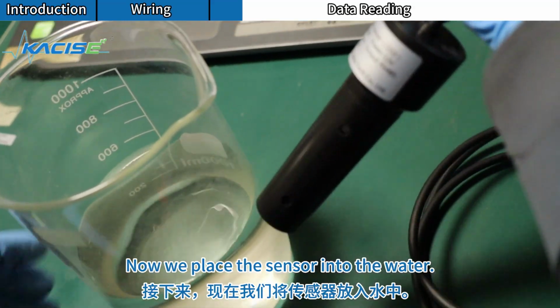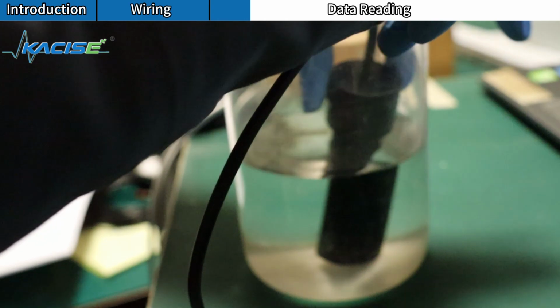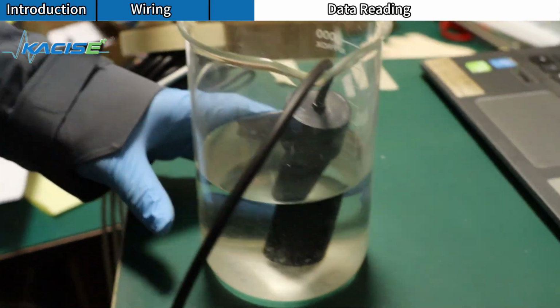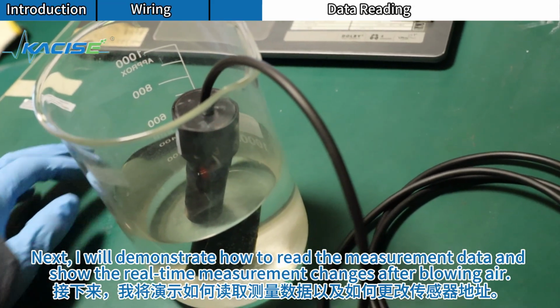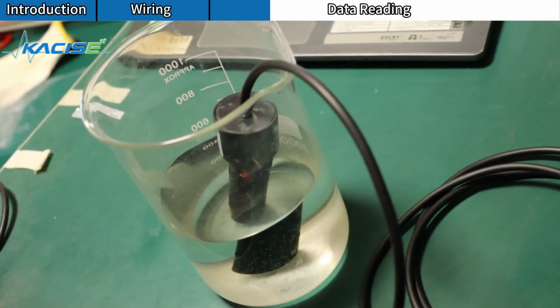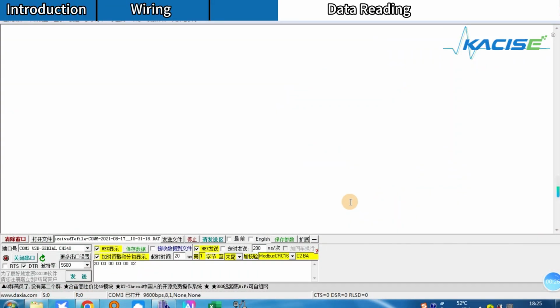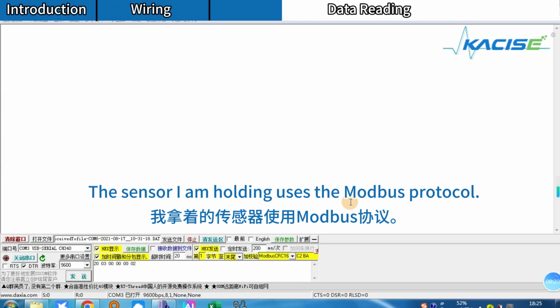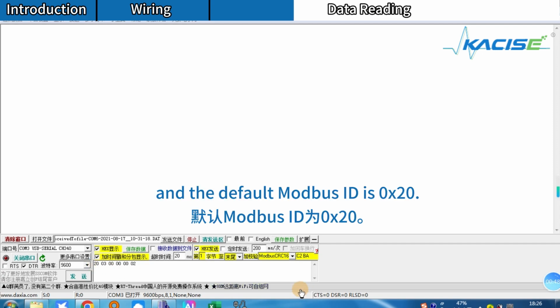Now we place the sensor into the water. Next, I will demonstrate how to read the measurement data and show the real-time measurement changes after blowing air. The sensor I am holding uses the Modbus protocol. First, the sensor's baud rate is 9600, and the default Modbus ID is 0x20.